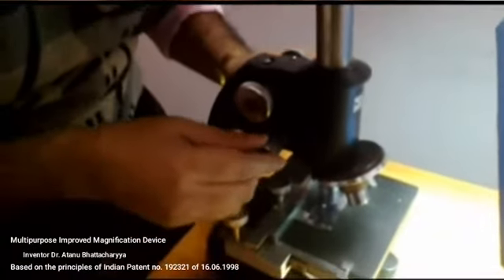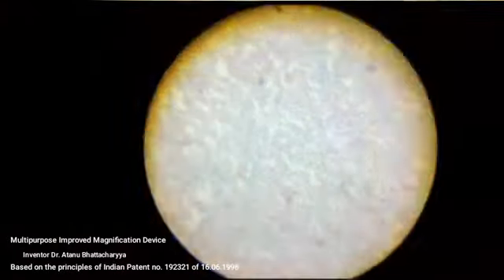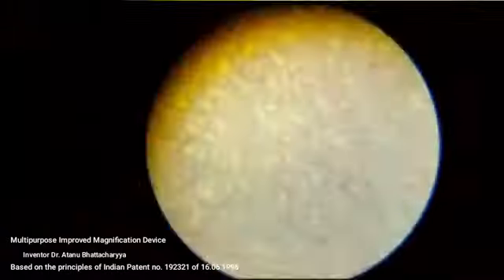The light adjustment is done, and by the fine and coarse adjustment screws, the adjustment has been done. Now I am trying to show you the view through the microscope. This is the normal view, that means the view without using the device. This is actually 400 times magnification.